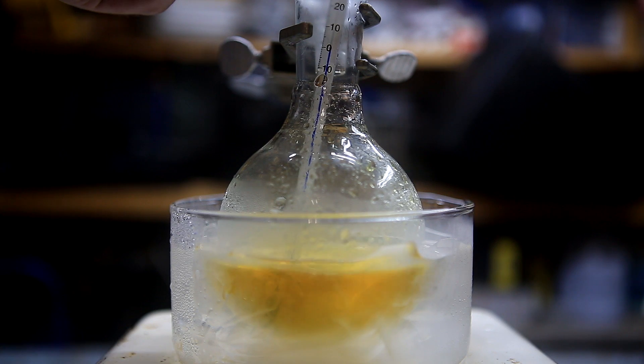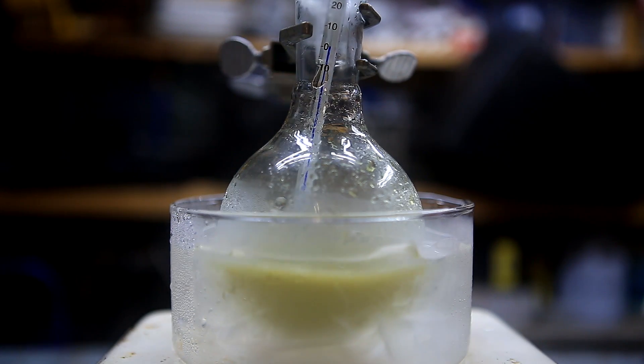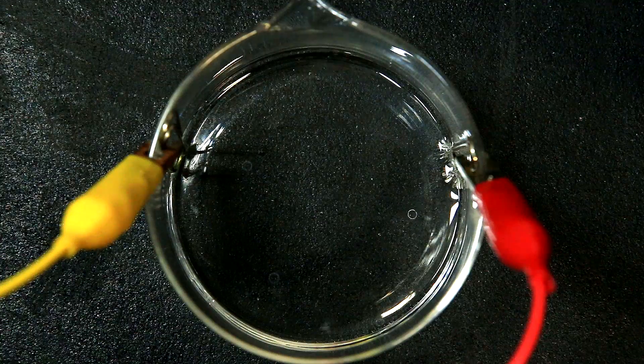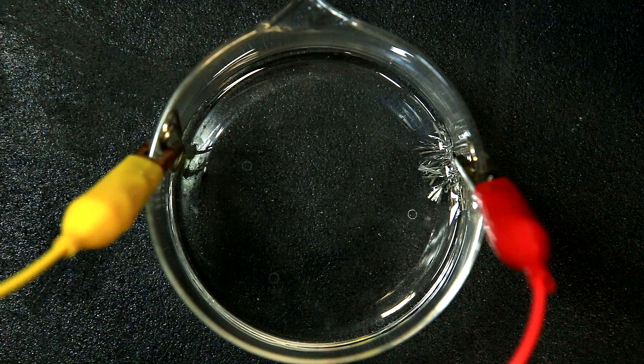Here's a shot of the solution being used as a reducing agent to make phenylhydrazine — when it's added to the solution you can see the phenylhydrazine precipitate out. In this example, I carry out the electrolysis of the stannous chloride solution and you can see tin crystals growing. I will show how I set this up in a future video.